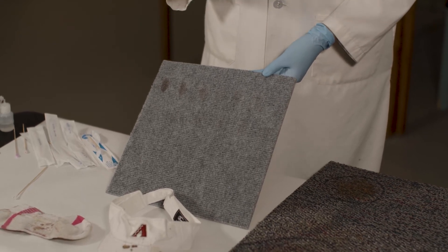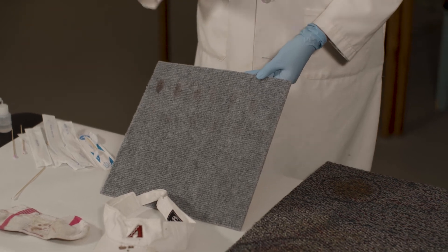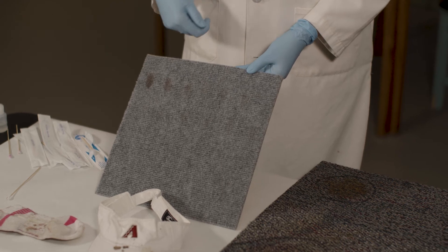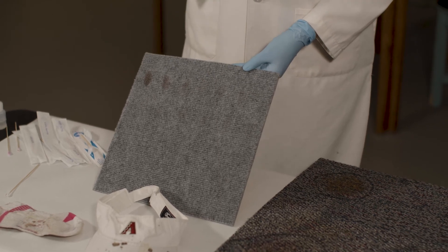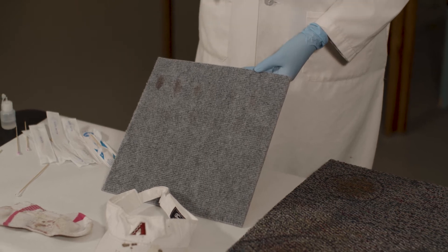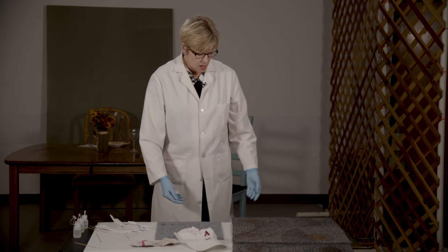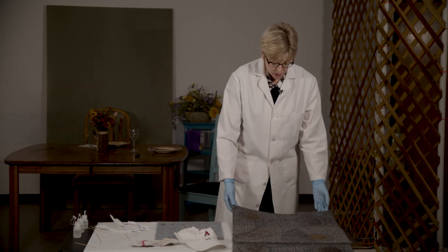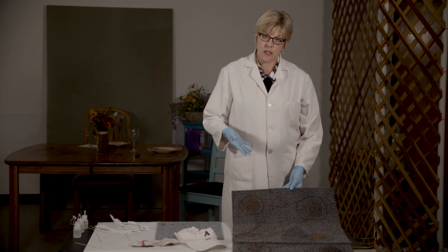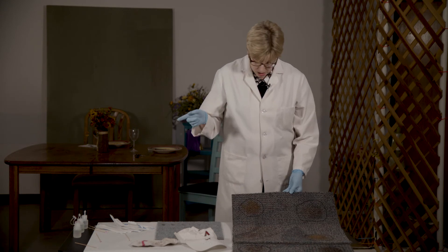Testing positive on a non-visible stain can be good and bad. In a research situation it's beneficial — you can test how dilute a sample can be and still get a reaction. In a crime laboratory it's not necessarily ideal, because we won't know if we can obtain DNA analysis from it.